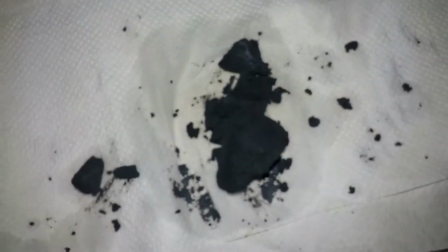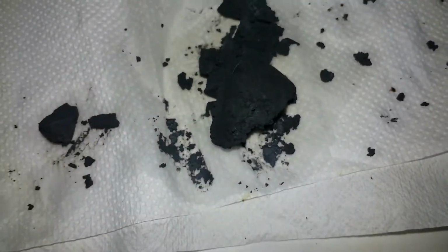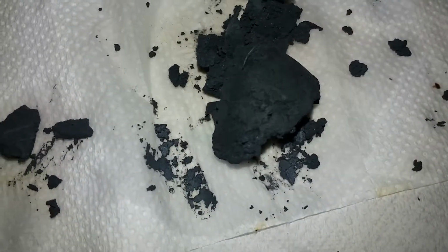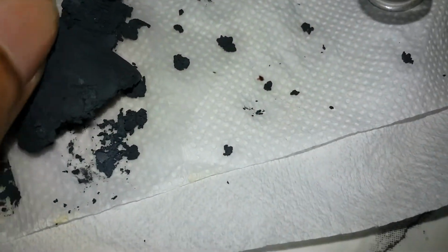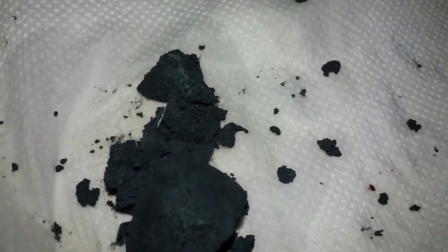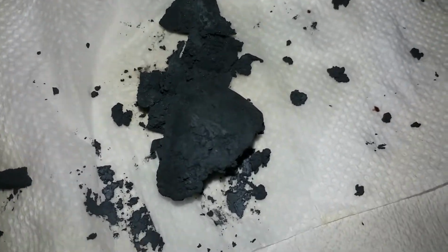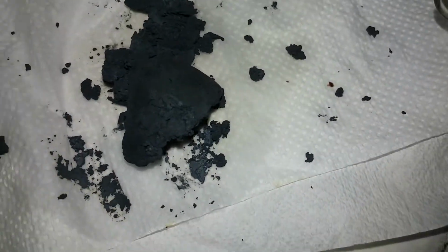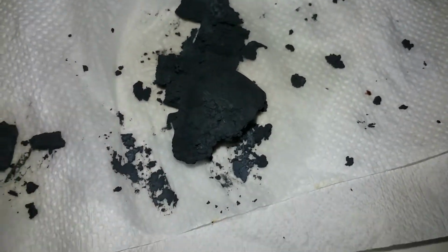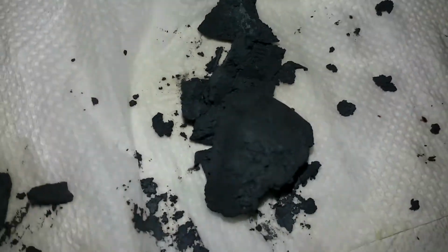Now here is our iodine. Wait, focus. So it is pretty impure. You can wash it more times to get the soluble impurities out, and there's some cotton. Okay, so actually with this method, using the nitric acid and the permanganate, we got a really nice yield. Using the peroxide and the other stuff does not give you much of a yield.